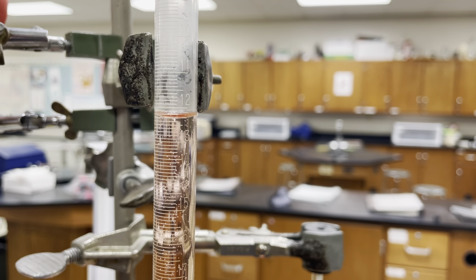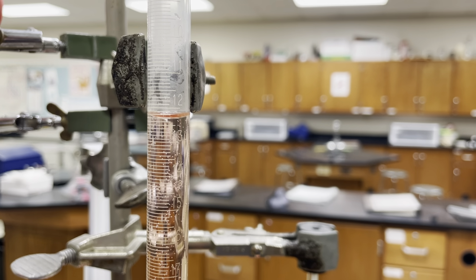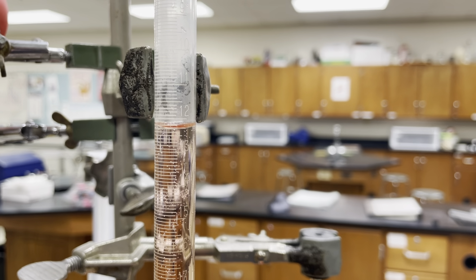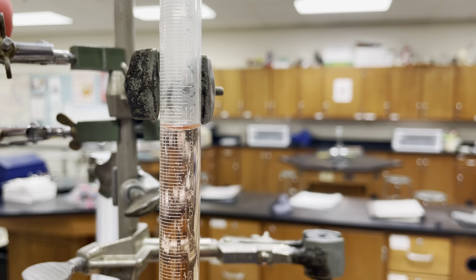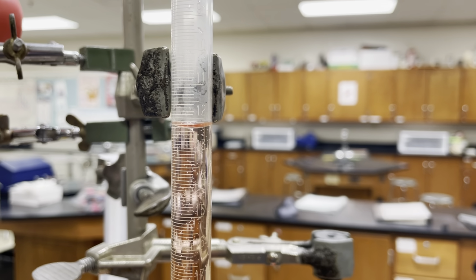I know for certain where 12.3 is, and I know for certain where 12.4 would be. So I can say this is 12.30 if it's landing right on 12.3. I can have two spots after the decimal place and go out to the hundredths place because I know the tenths place for certain. Therefore, the next digit out should be my uncertain digit.